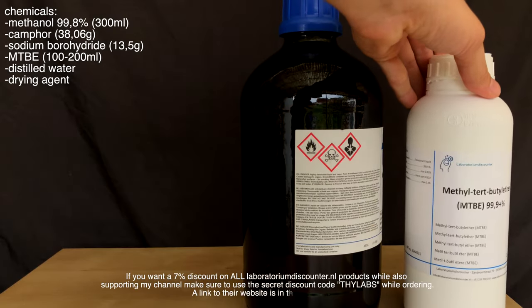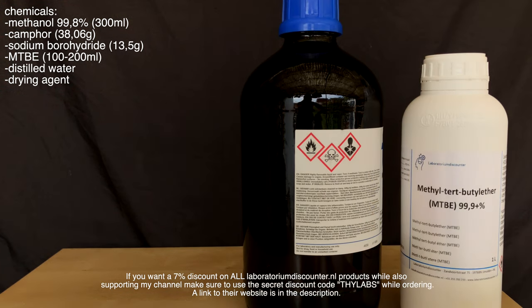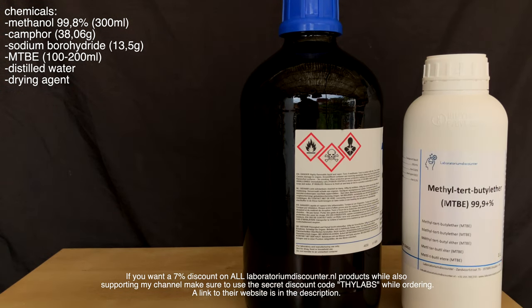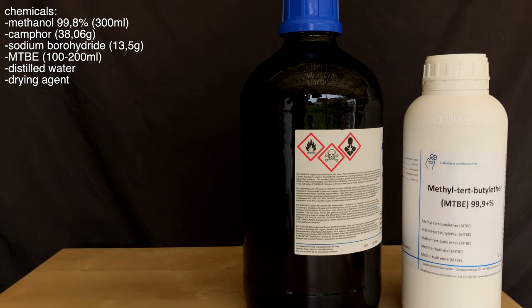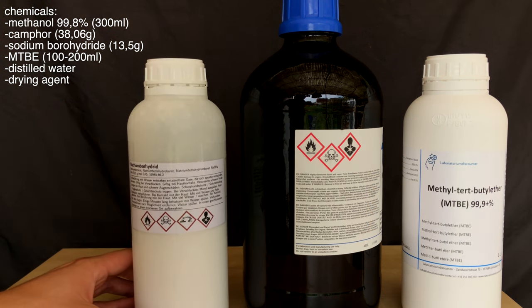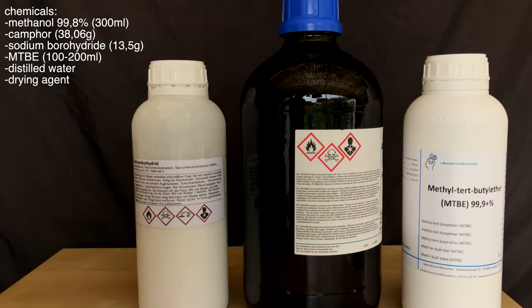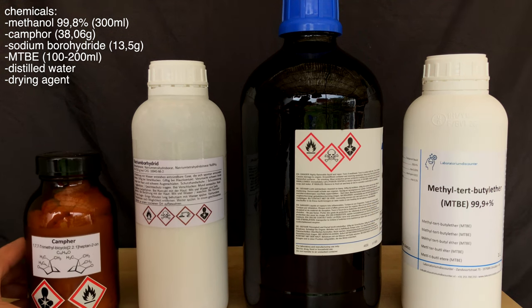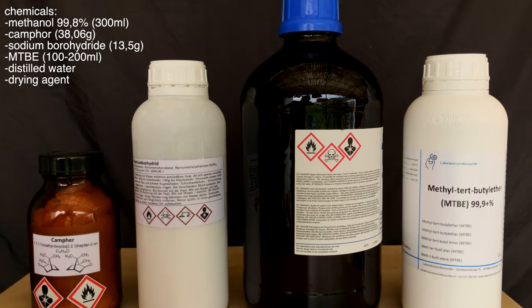The chemicals needed for this are quite simple. We use 99.8% methanol, camphor, sodium borohydride, distilled water, and a drying agent. Methanol is the driest alcohol I have and instead anhydrous ethanol could also be used. As an extraction solvent MTBE will be used.